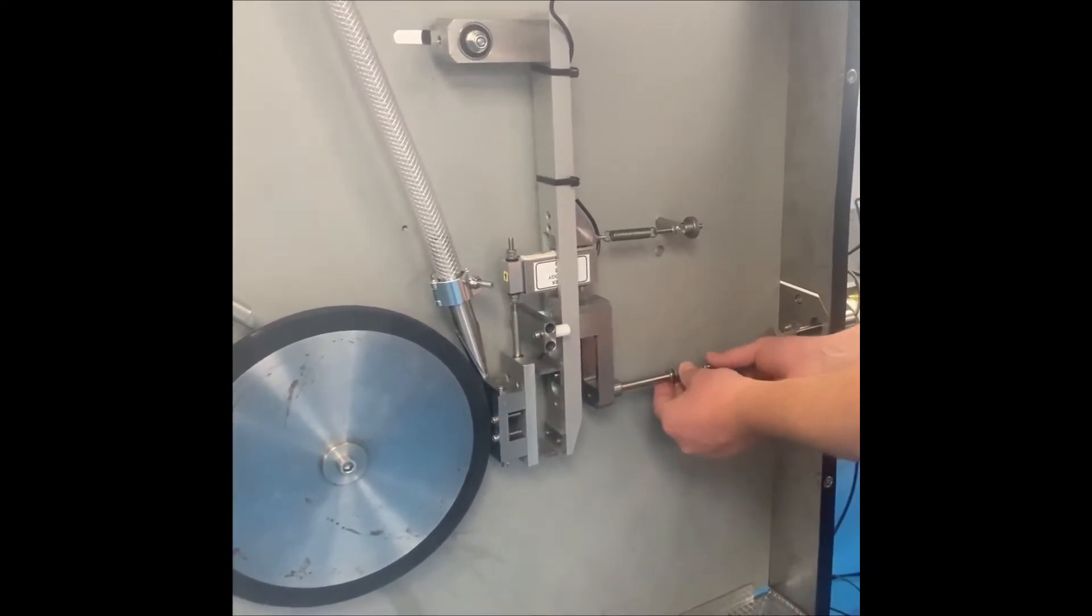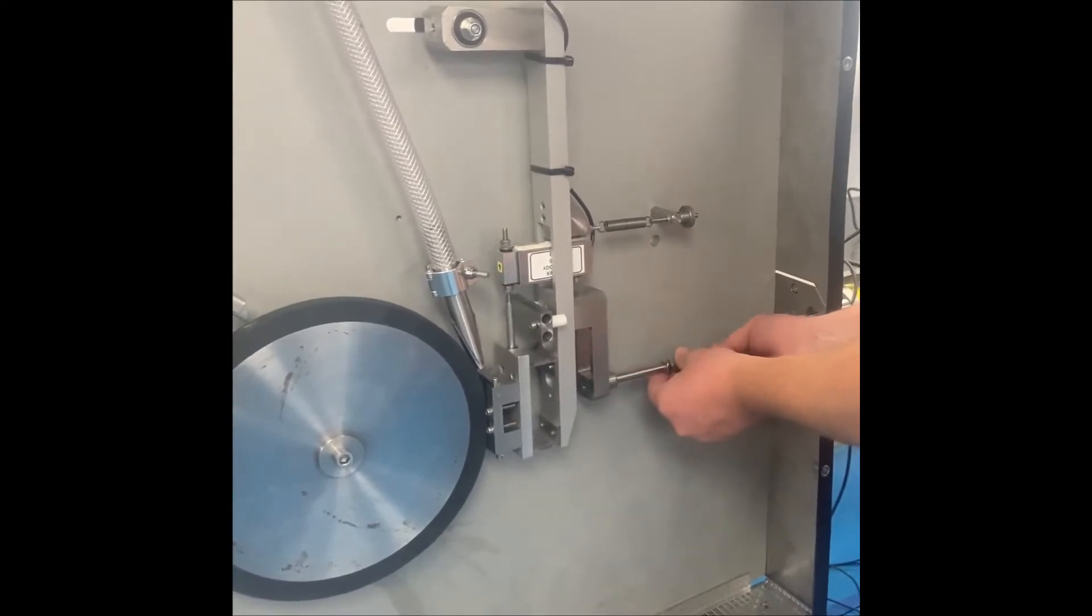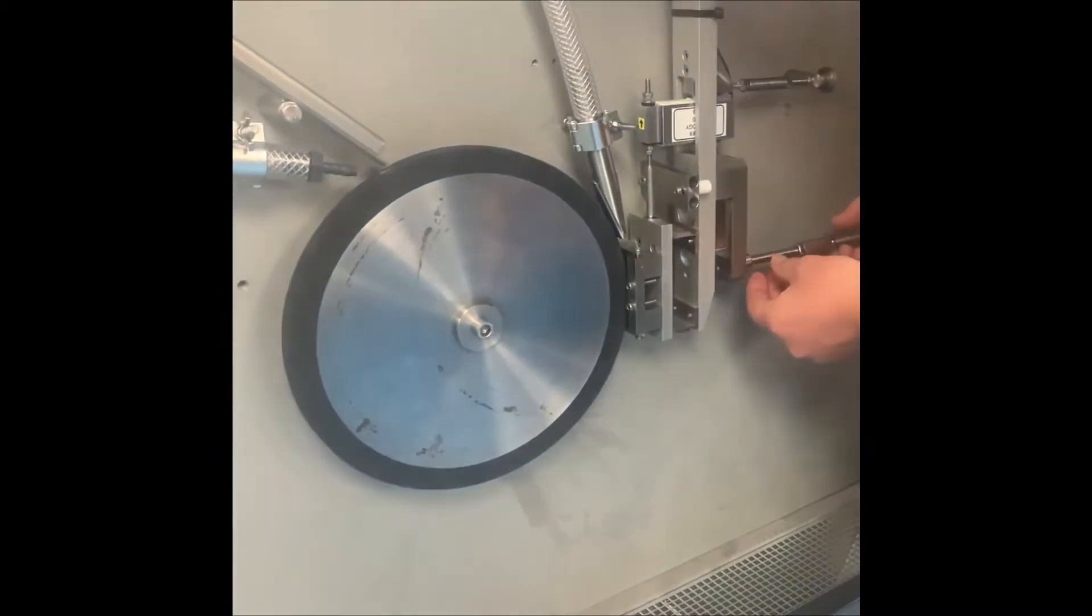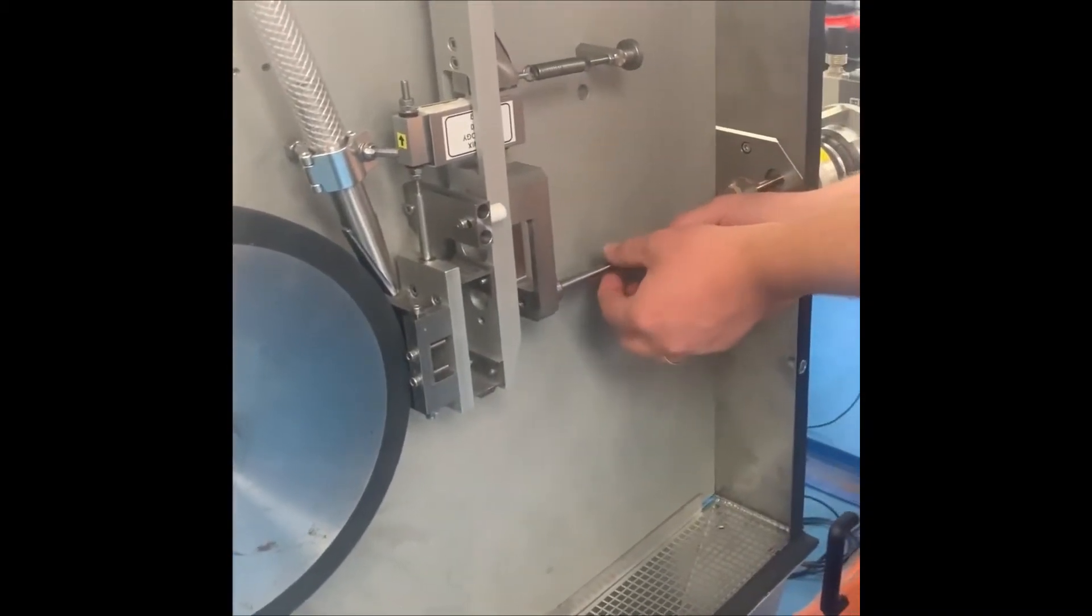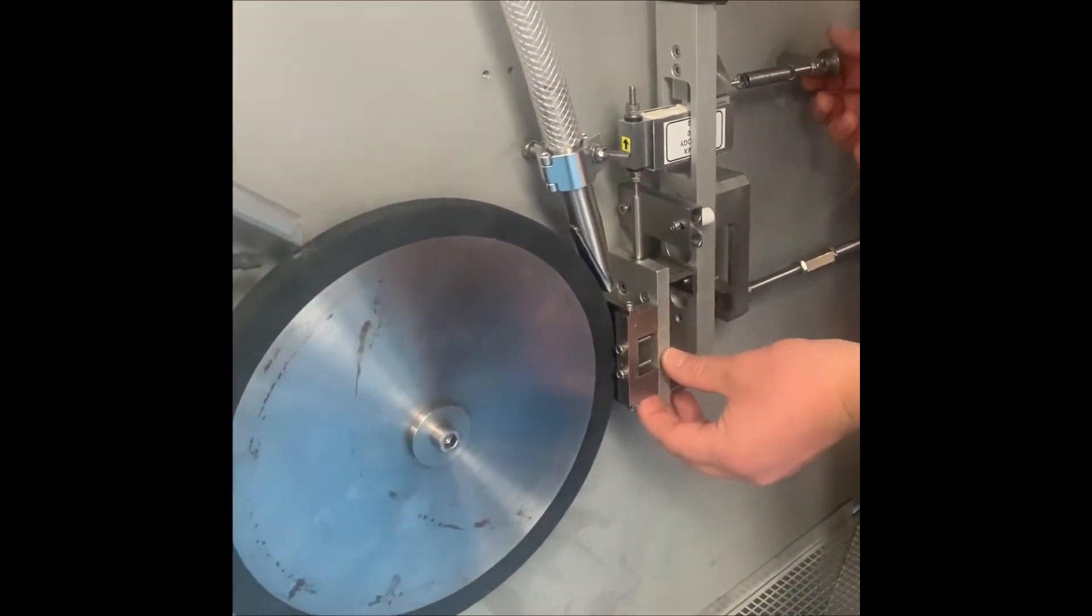Now insert and trim the length of the loading rod. This should be adjusted to bring the specimen lightly into contact with the wheel. Seat the specimen in the holder and ensure that it aligns with the wheel.